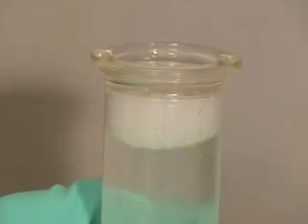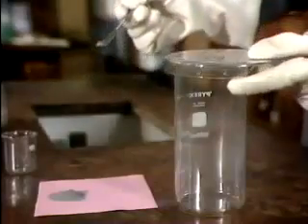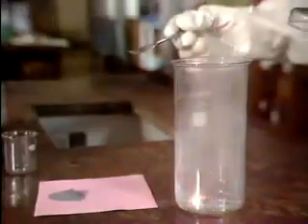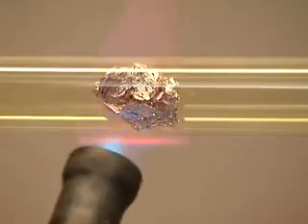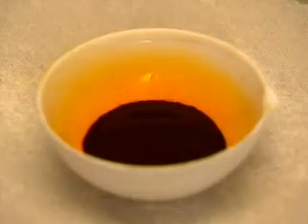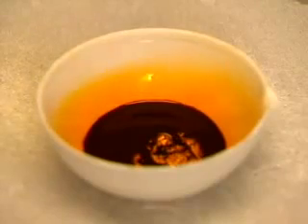Now let's see how the halogens react with aluminium. When aluminium powder meets fluorine gas, the reaction's over in a flash. To get chlorine to react with aluminium, I'll heat some foil in a stream of the gas. The white fumes are aluminium trichloride. With bromine, I just drop aluminium foil into the liquid. There's a short delay, but normal service is soon resumed. Once the reaction gets going, it quickly takes on the appearance of a pit of hell. As with the chlorine reaction, there's white smoke — that's aluminium tribromide.